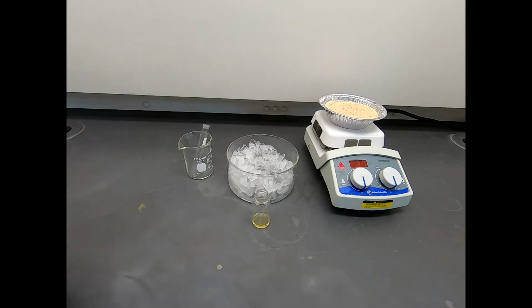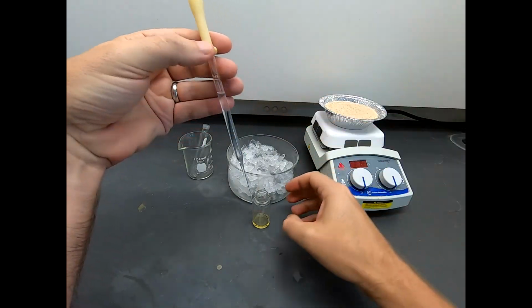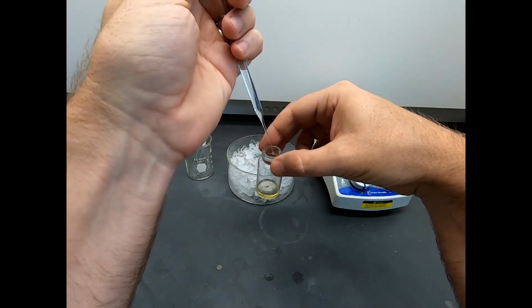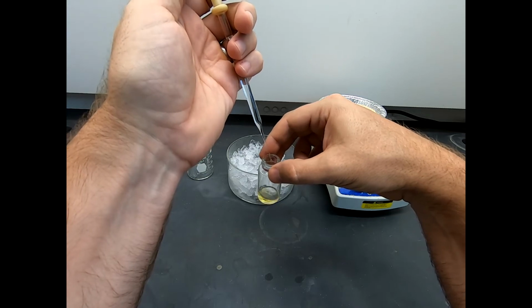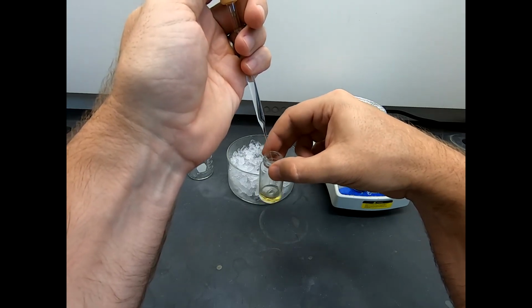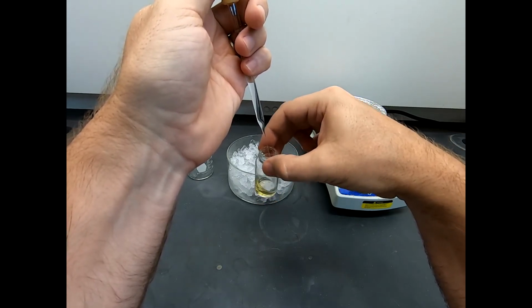Okay, now let's bring in the hexane. And so we need about 6 milliliters. I'm not going to be super careful about this 6 milliliters, but I just need a decent portion. That's about a full pipette, which is close to 2 milliliters. I'm not very coordinated with my left hand, so I'm going to hold the pipette with my left hand, and I'm going to gently swirl this vial with my right. I'm just going to swirl this in.